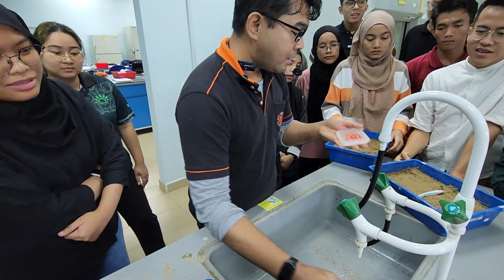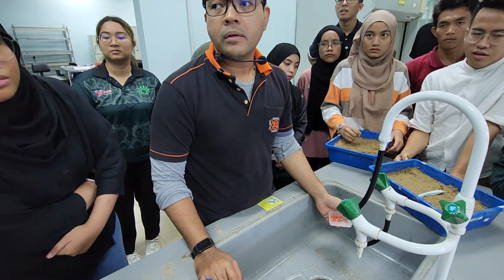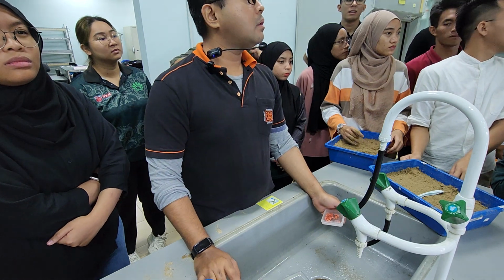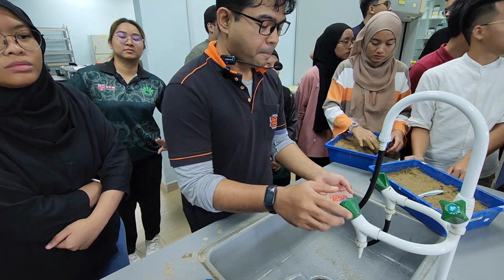Kan itu rendam ya. Actually, that's what I want to show. Ada cling wrap. Maybe. Can you get a cling wrap? Plastic wrap.